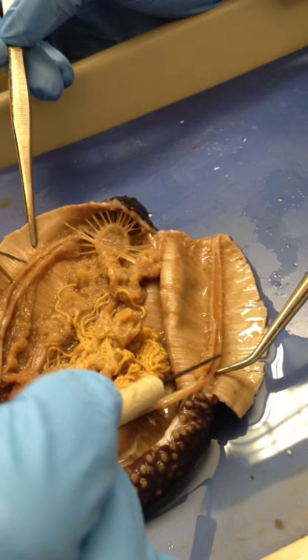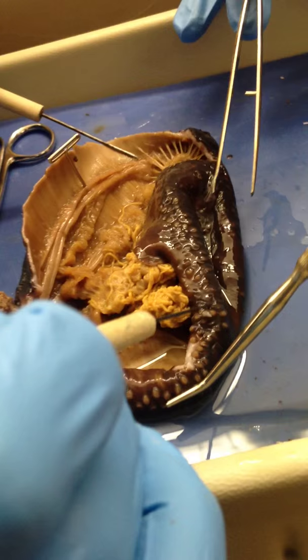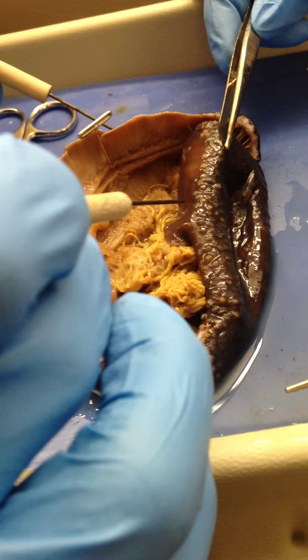This little tiny soft tissue — they look like giant vesicles. And so there must be actual tube feet. That flesh just got pierced crazy easily. Where are the tube feet at? They technically are on the other side — these little tentacle sucker thingies. They're just not full of water, or maybe there's a bunch of them in there. I think those are them. They're just not full — they collapsed.